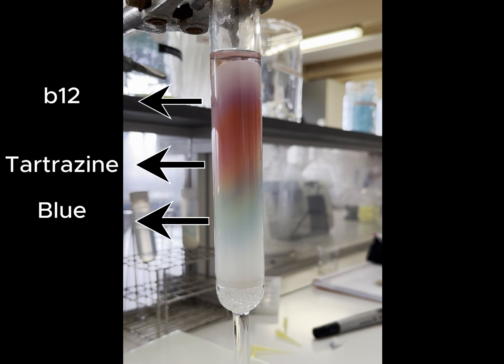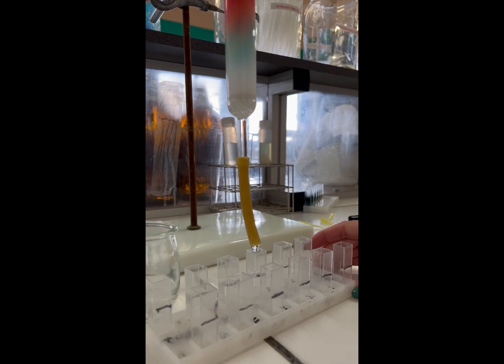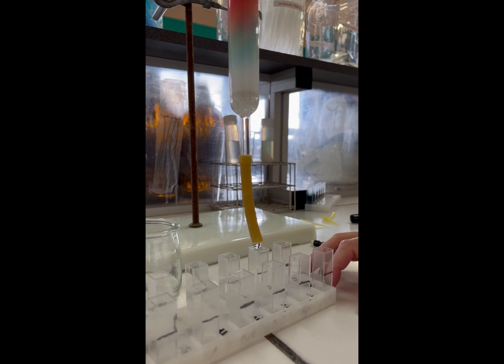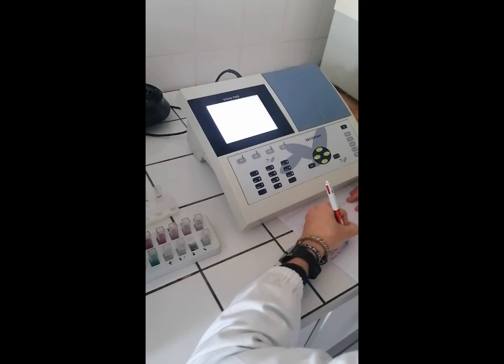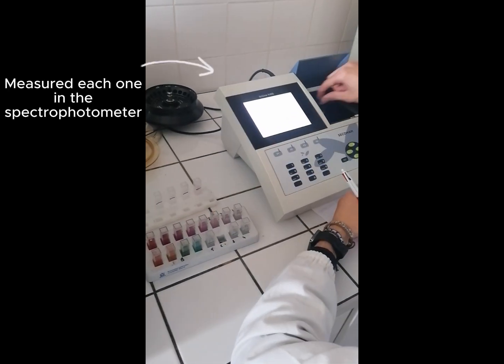We can immediately see that the dyes divide and that the blue descends faster down the column because it's heavier than the tartrazine, and finally the vitamin B12. Then we collect the dye fractions in different tubes. Once the 20 tubes have been filled, we run the tubes through a spectrophotometer to study the absorbance of the blue, the vitamin B12 and the tartrazine.